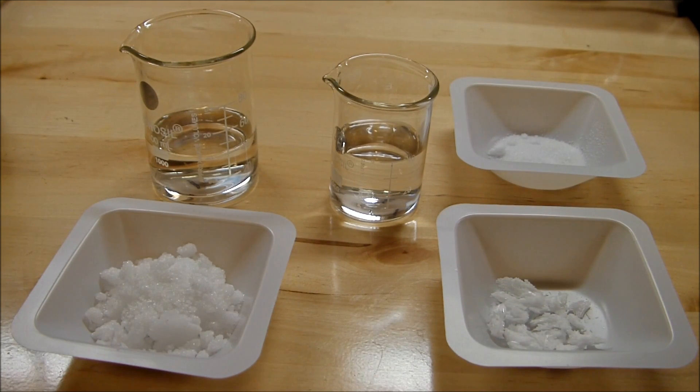These will be made into two different solutions. Solution A on the left will be the ethanol and camphor, and solution B is everything else on the right.